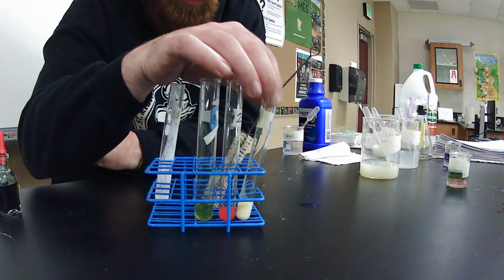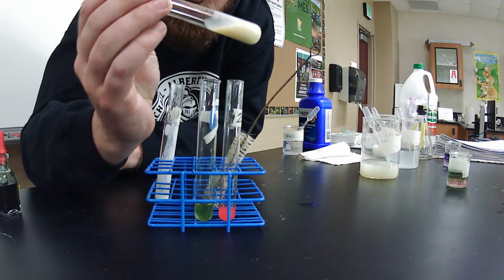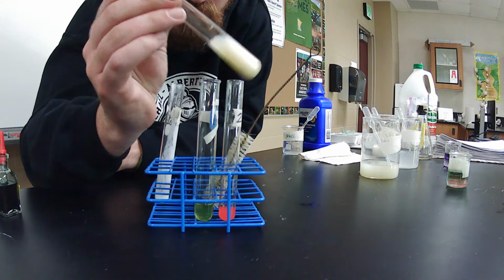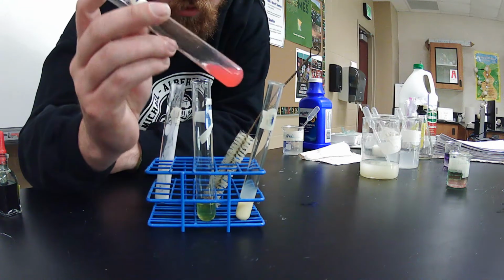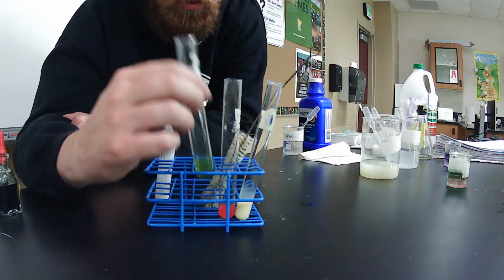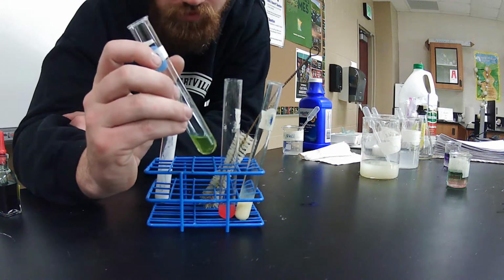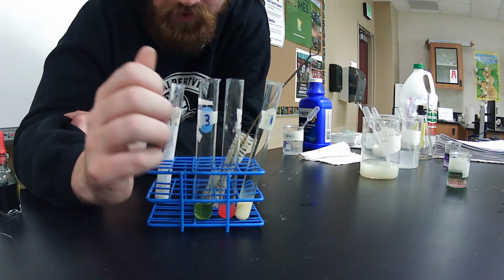So, yellow: this is partially acidic. It's a hot color, partially acidic. Lemon juice turns out pretty pink. It's going to be very acidic. Our green should be relatively neutral. This gives us our variety of different results.